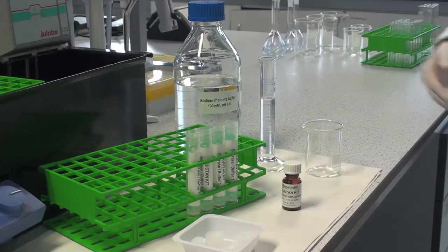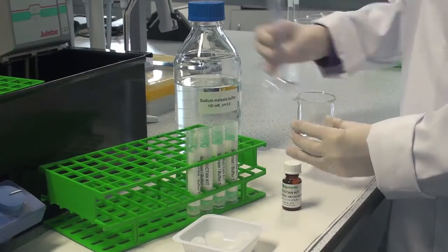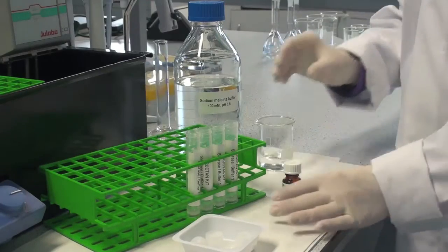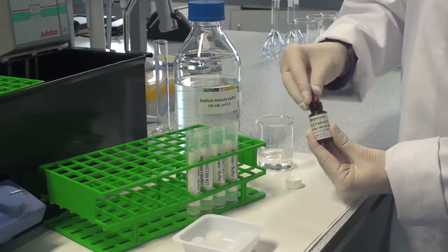Dissolve the contents of bottle 1 in 22 mls of buffer 1, which is sodium maleate buffer 100 millimolar pH 6.5. This is termed enzyme solution A.